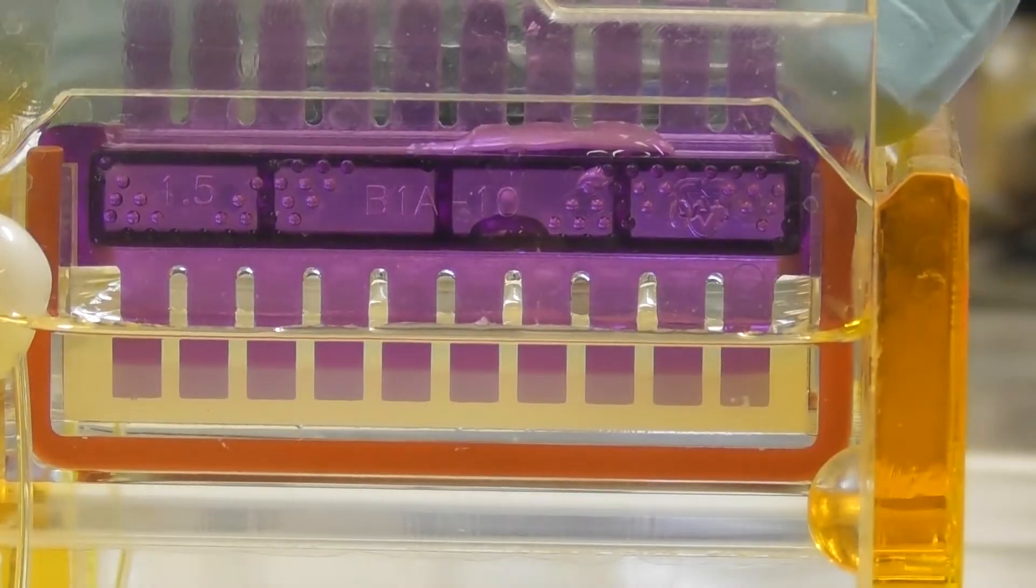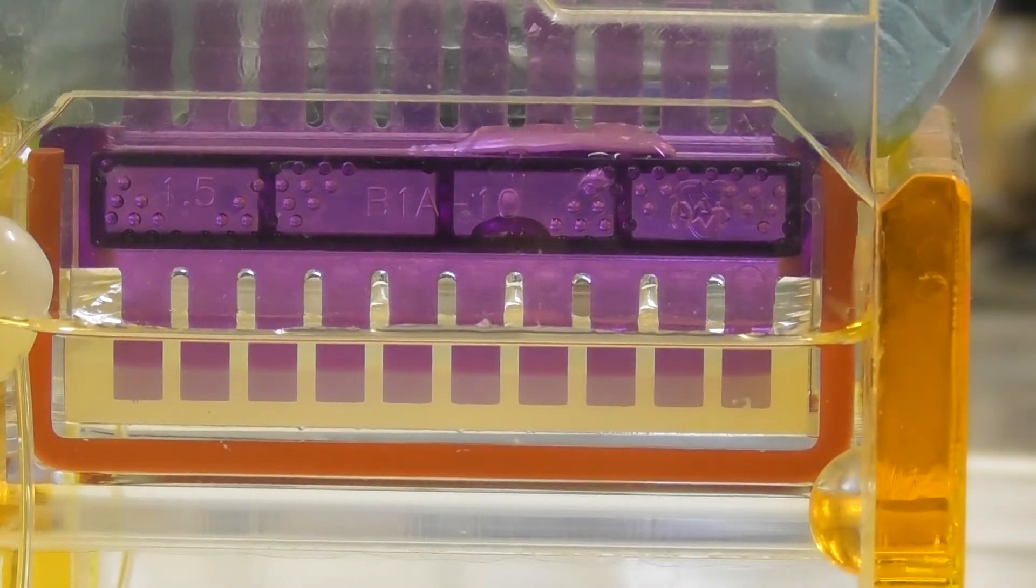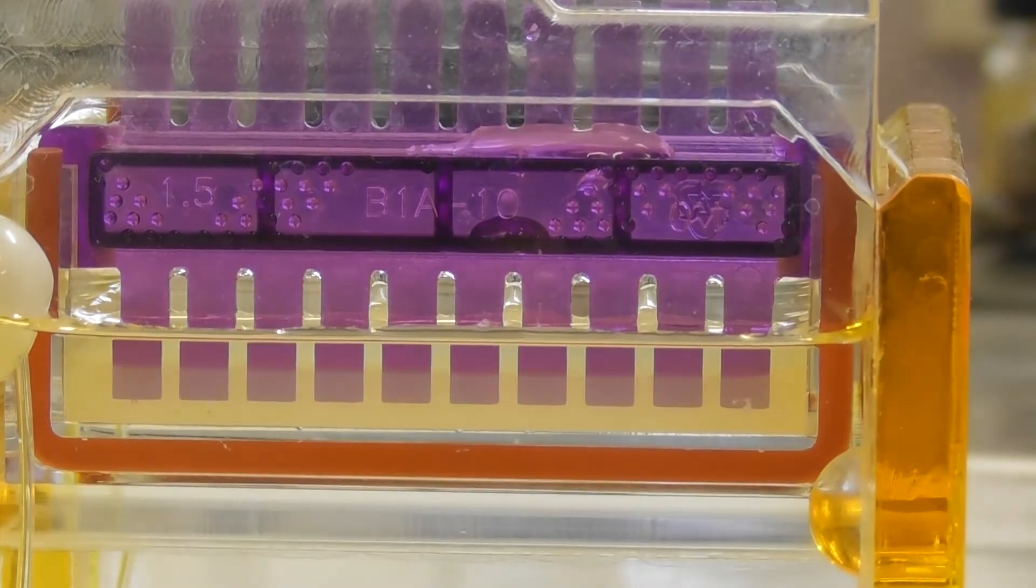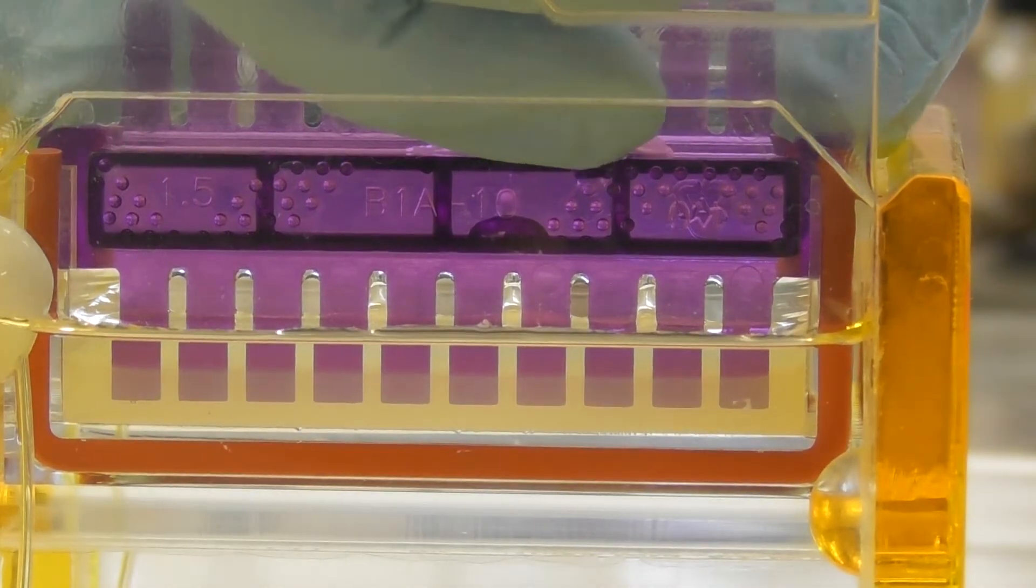To begin loading your samples, first gently remove the comb by pulling directly upwards on the comb while supporting the gel tray.